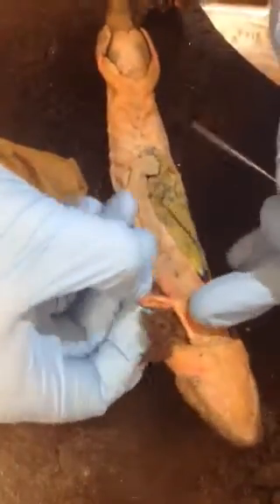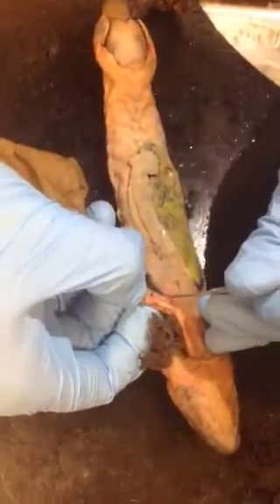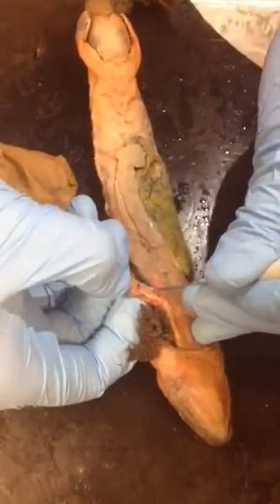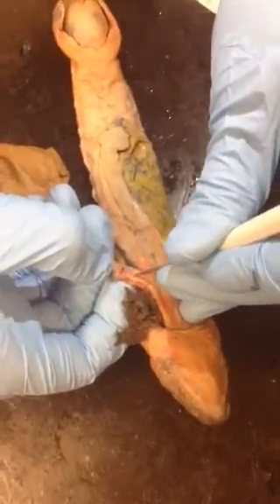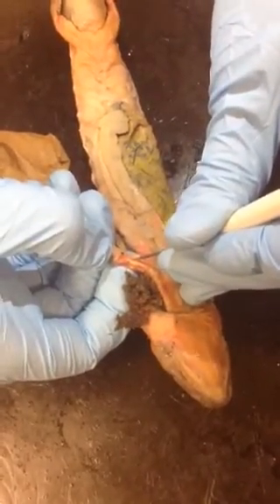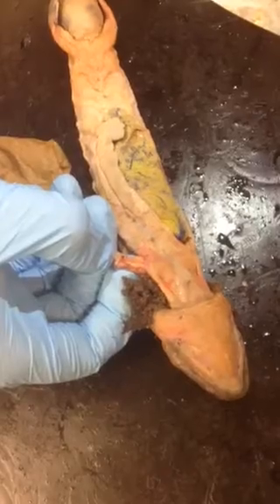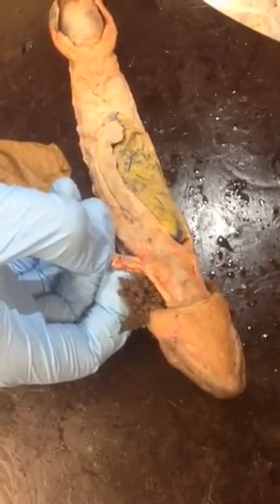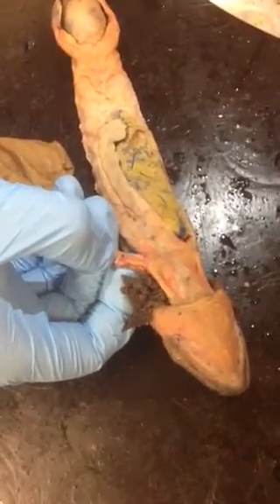And I believe that's the triceps brachii. There's one there. That one is the coracobrachialis, also known as the coracohumeralis. And this one in the center is the humeroantebrachialis. Can anyone tell me what that's homologous to in the cat? The biceps brachii. All right.